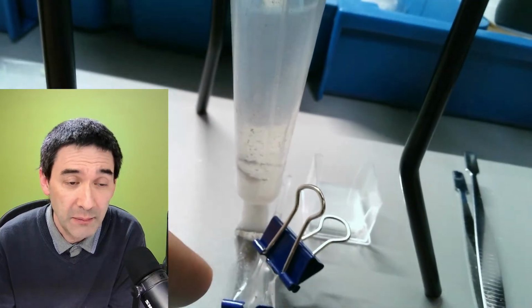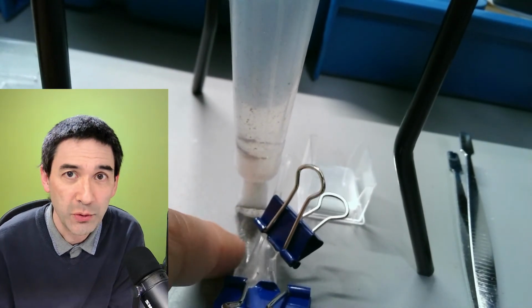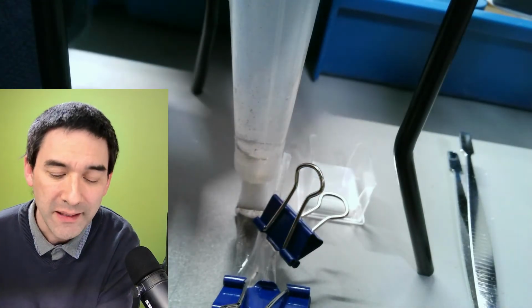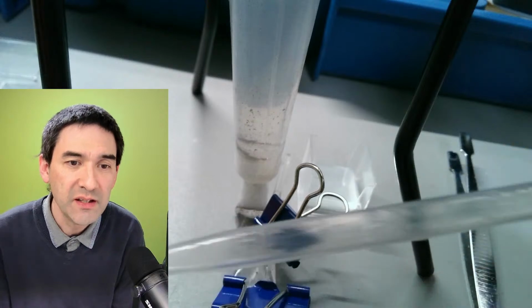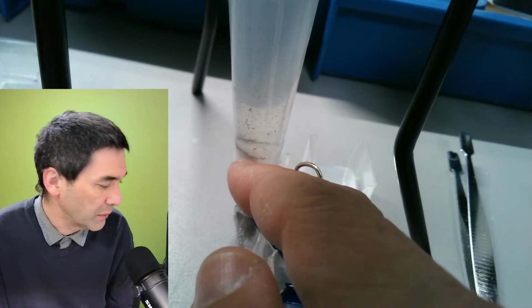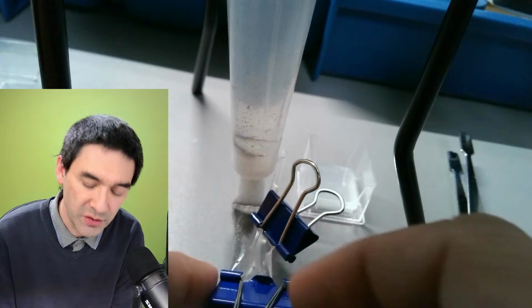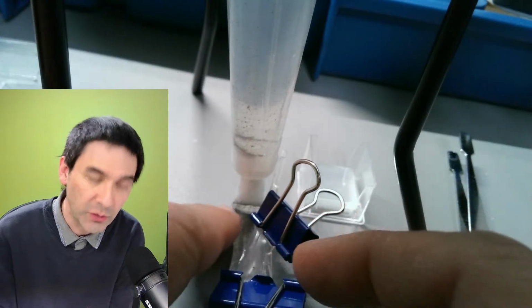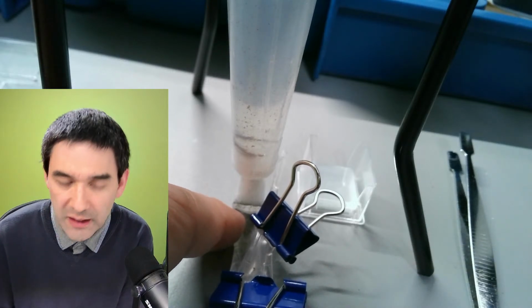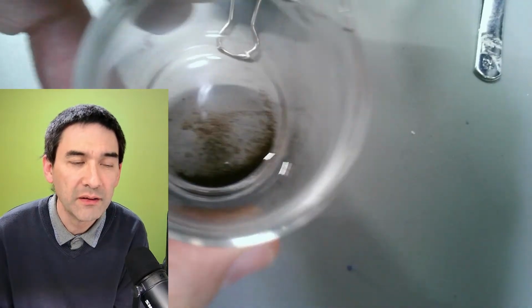And on the bottom here, this is supposed to be a rubber hose. It's not. I simply used a disposable pipette. I used one of these things here. It was very flexible, and I connected it down here with so-called parafilm. I'll show you what that is, and then I used some clamps to hold it together, to prevent the water from flowing out. And you can already see here, these are where all of the particles are. And already today, a couple of hours ago, I've actually collected a few samples here.